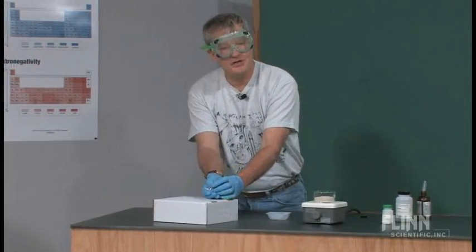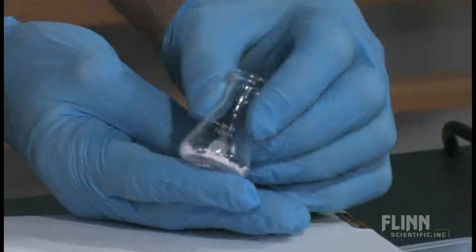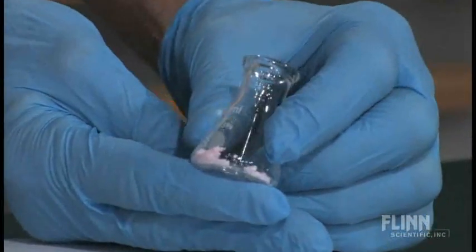Now, what you're seeing here, and I want to point out a couple of things, this is a pinkish colored solid.